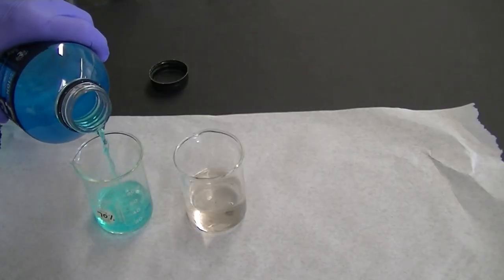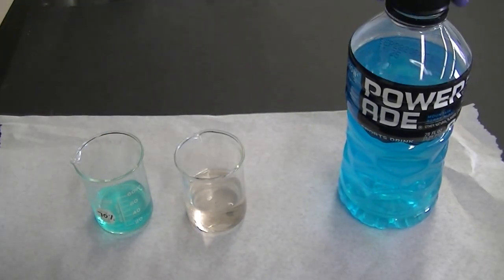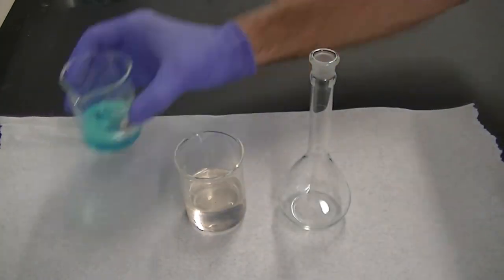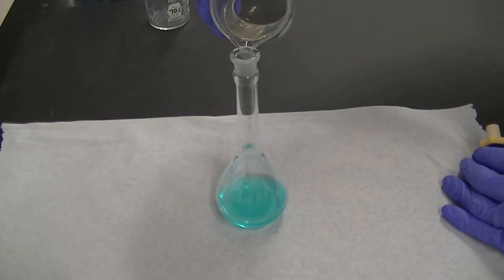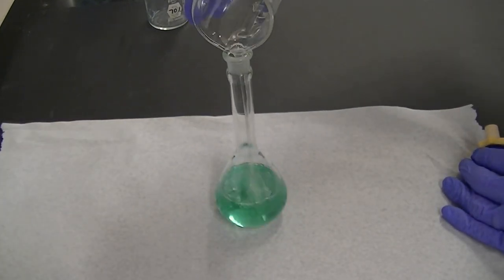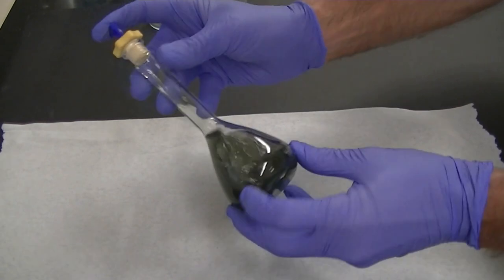The silver solution was finally ready for the reaction with the sugars in the Powerade. I first poured the Powerade into a flask, then added the silver solution. The mixture immediately turned a dark color, indicating the formation of some silver metal.